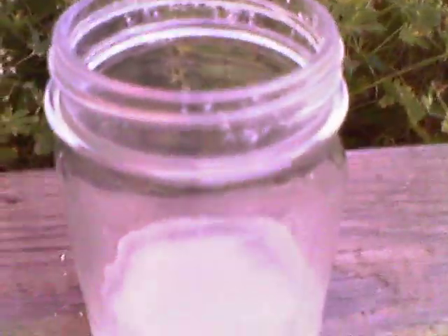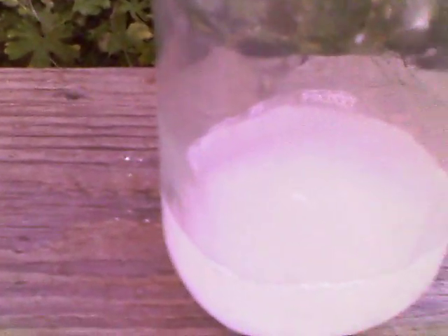But what happens is, almost immediately, my magnesium chloride will be dissolved — what's going to react — and it's very hygroscopic, which makes it an interesting chemical.